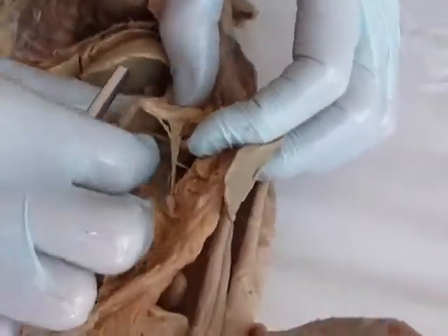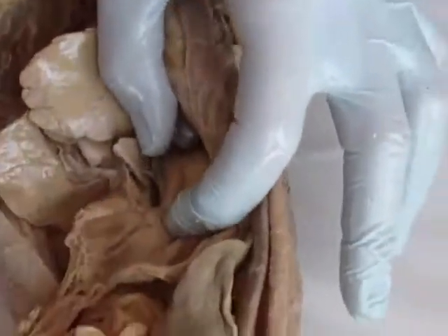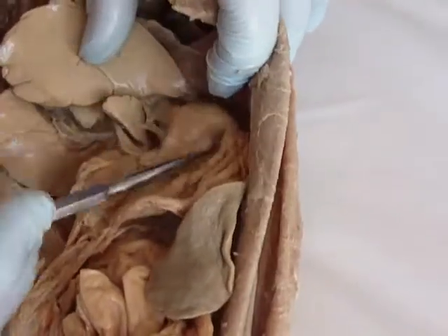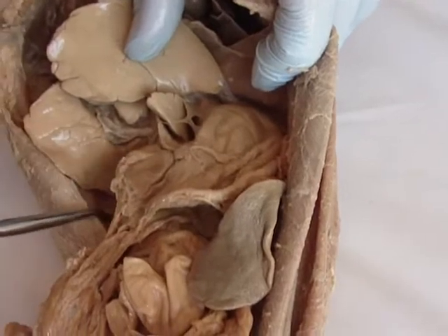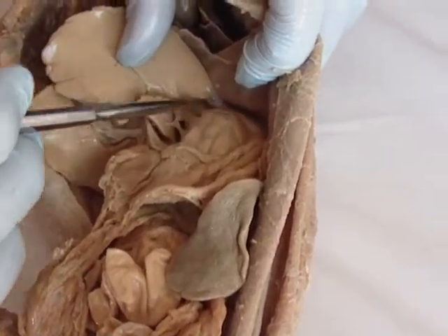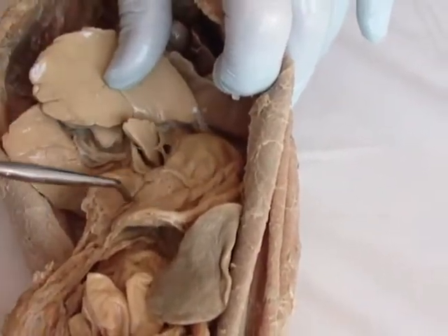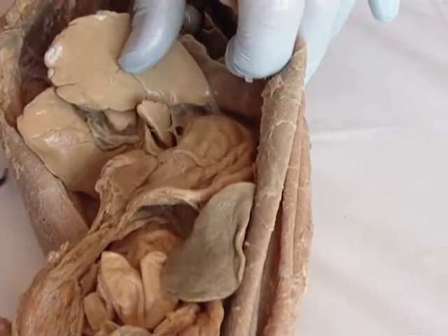Your greater omentum is attached to the greater curvature of the stomach. The lesser omentum is attached to the lesser curvature of the stomach. Food enters here and exits here. Where your food enters is the closest area to the heart, so that's called the cardiac region. Fundus is the top curve, then the body, and right before it exits you have the pyloric region.